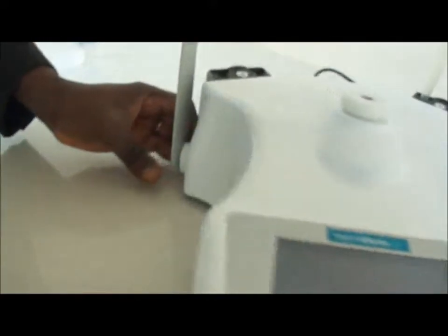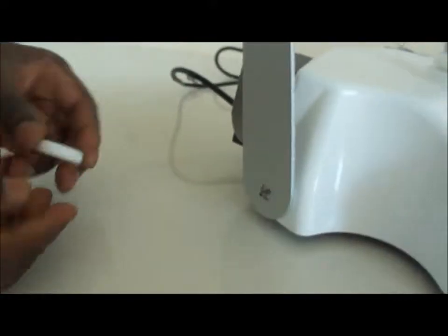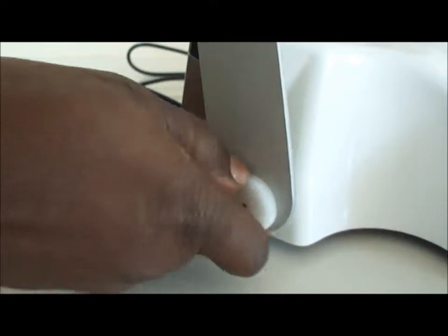On the other side also, you have this small stick on which you will screw this small disk. Therefore, the pump is mounted.